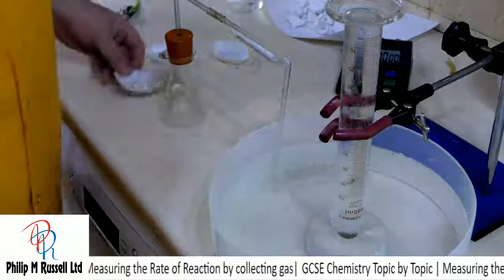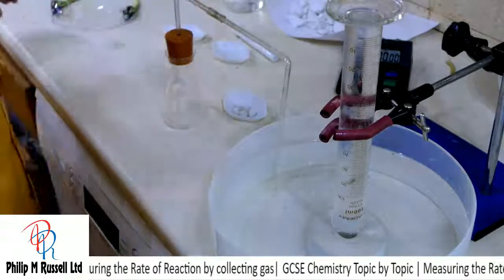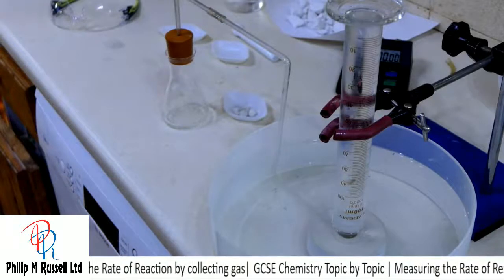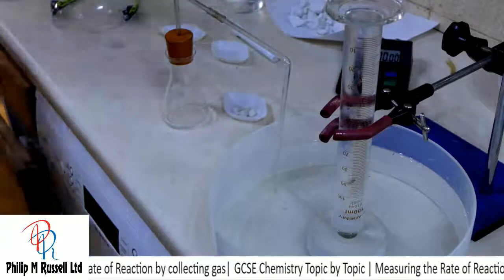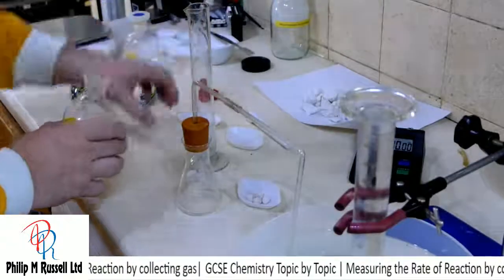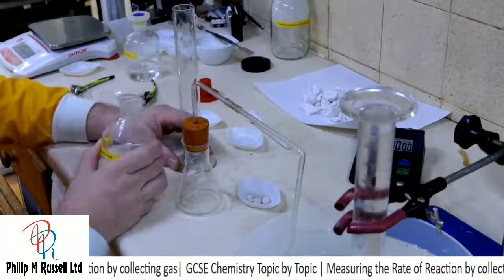We're going to use the small pieces, and I'm going to add the acid to that. Fortunately, I have another 100 ml measuring cylinder, and I'm going to measure out my 30 cubic centimetres of acid.